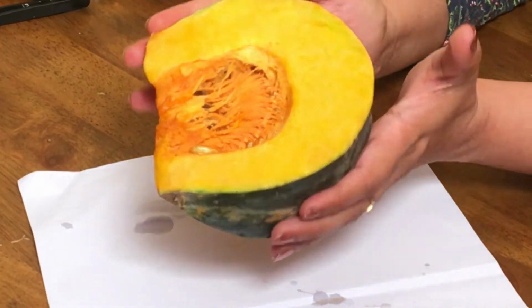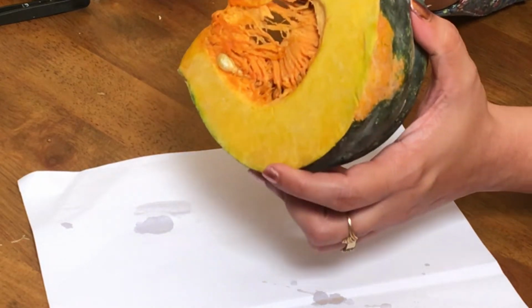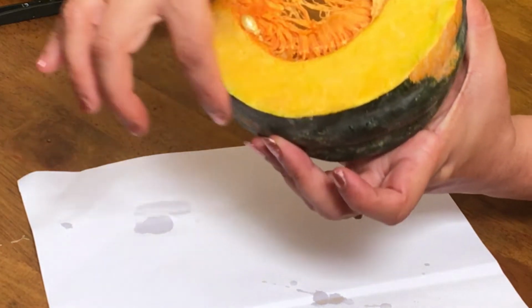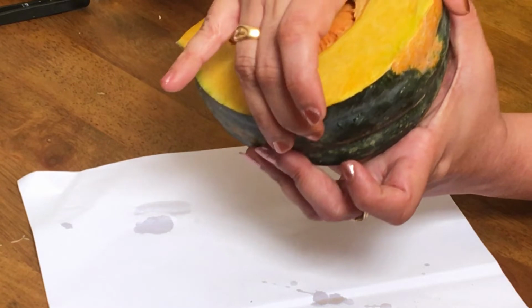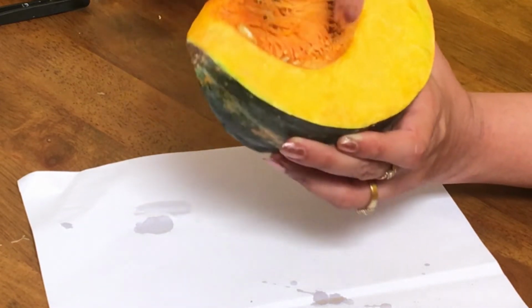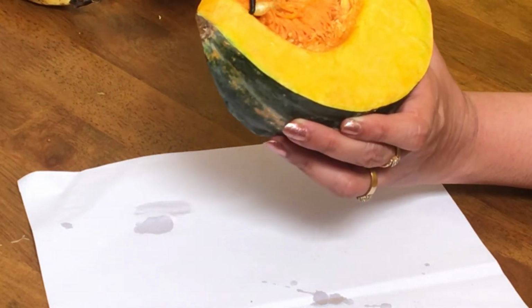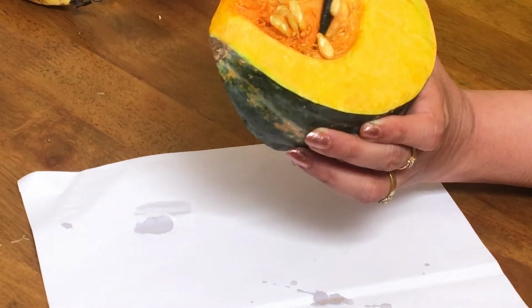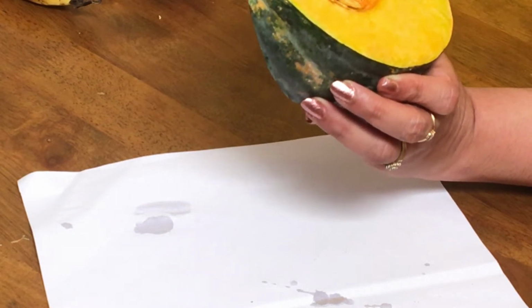This is a slice of pumpkin. Even this is also a fruit. This type of fruit is called as pepo. Why? Because it is having a thick rind. This is a very thick rind which we generally peel off, and this rind is actually the epicarp. This edible part is the mesocarp, and inner part is the endocarp, and you can find a lot of seeds inside. This is a pepo because it is having a thick rind and also many seeds inside. This is called as a pepo.